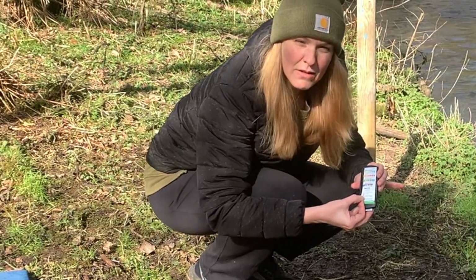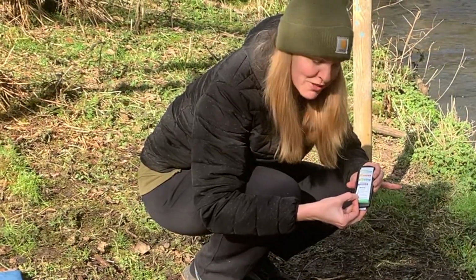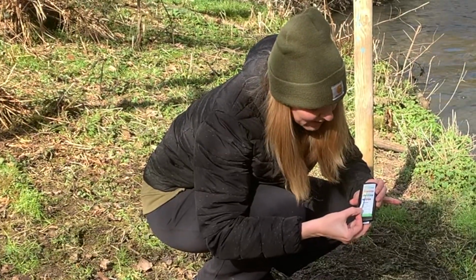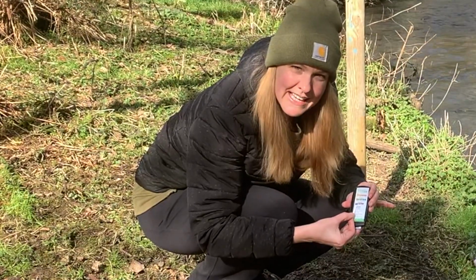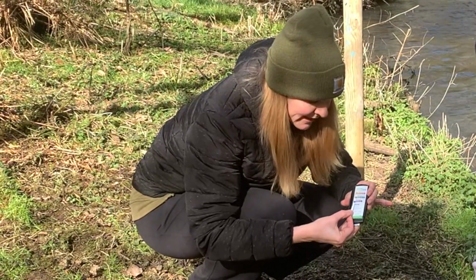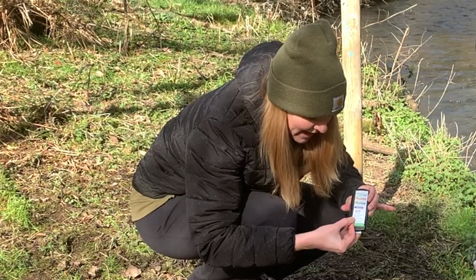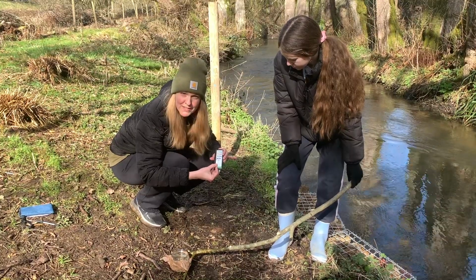We're close to the start of the riverway, and so our pH is much lower here, which is very interesting. You'll probably get a much different reading. I think it's probably between 6.4 and 6.8. So I'm gonna take the exact center, which is 6.6. Alkalinity of 40. And hardness is between 0 and 100, so I'm going to record 50.